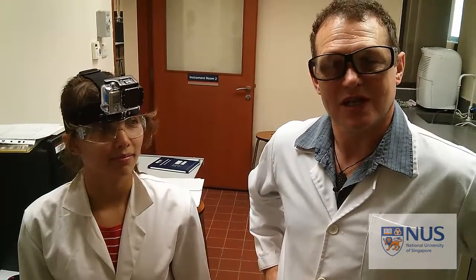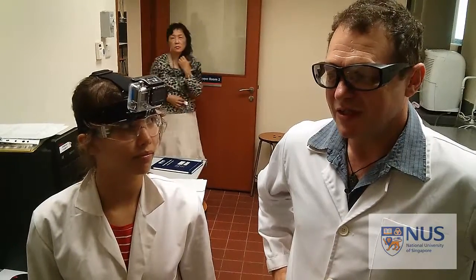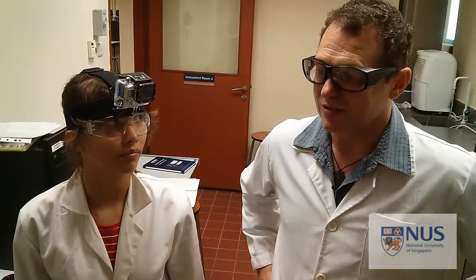I'm Simon. This is one of the module CM3292 practical videos. The idea of these videos is to show you the equipment you'll be using and how that equipment works in terms of your use of it. So we won't particularly refer to the practical, which is the electrophoresis in this case. Instead, we'll start by turning the equipment on, walking you through the use of it, how it works and how the software works.